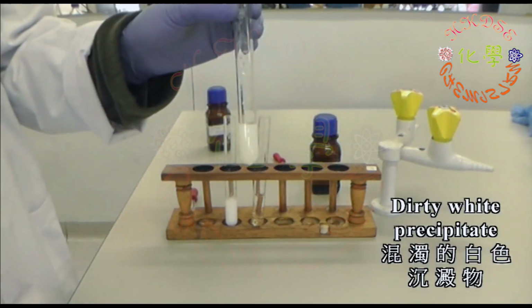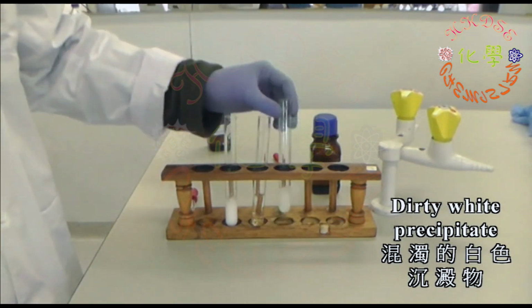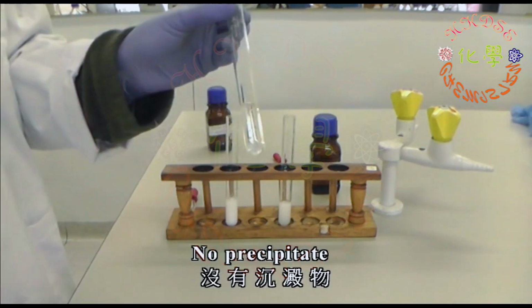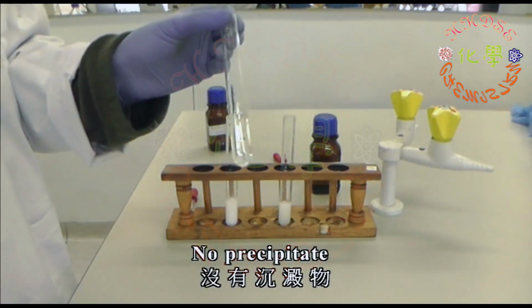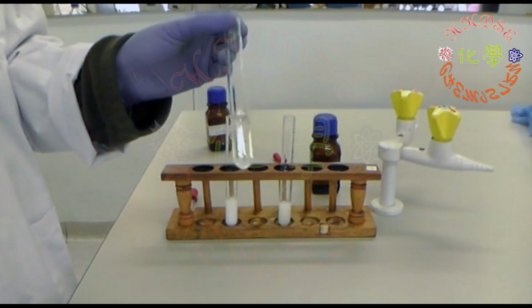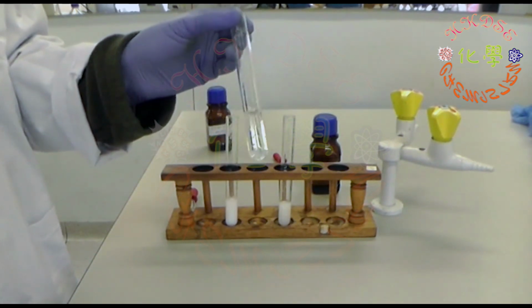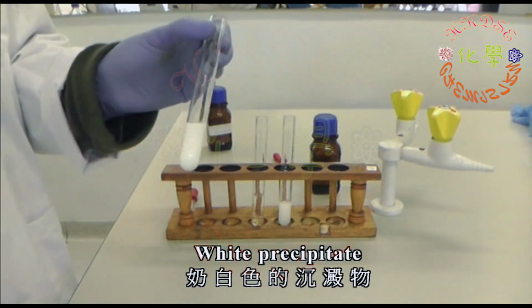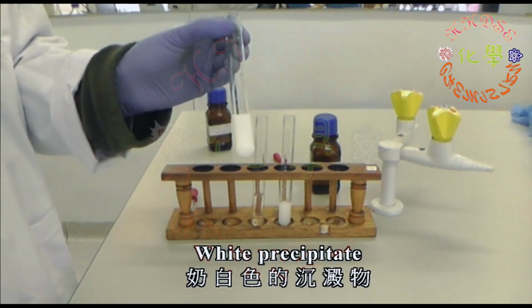The dirty white precipitate is silver carbonate. The solution in sodium sulfate's test tube remains clear and colorless. And the white precipitate is silver chloride.